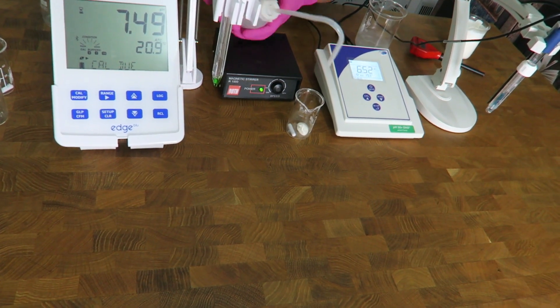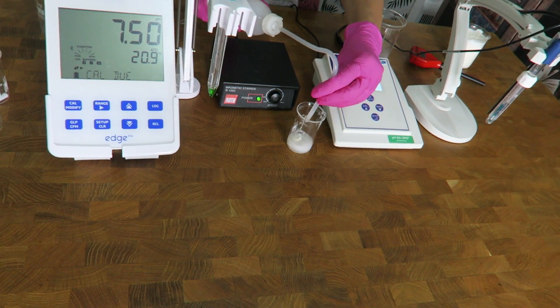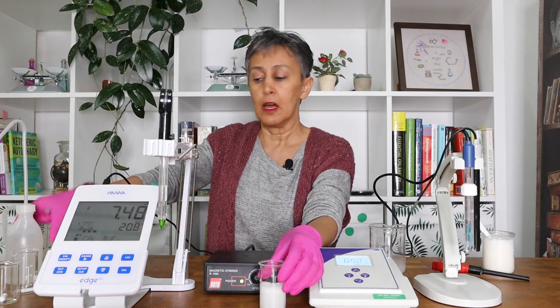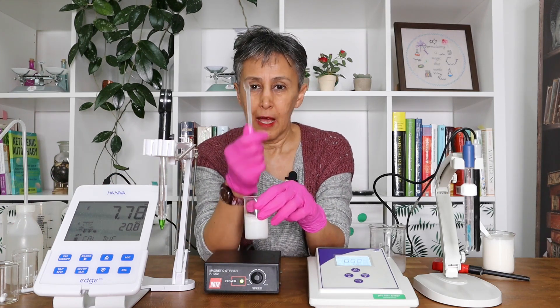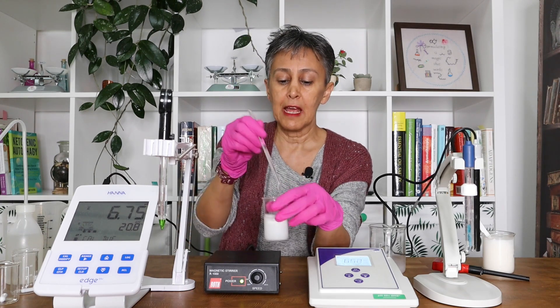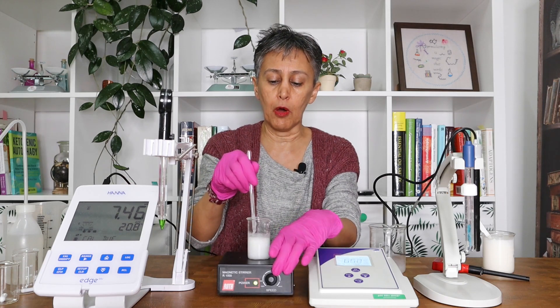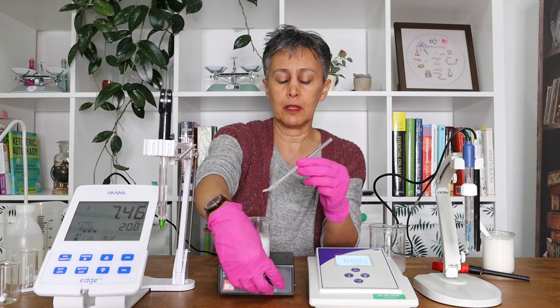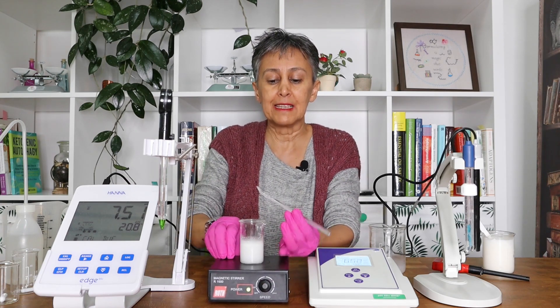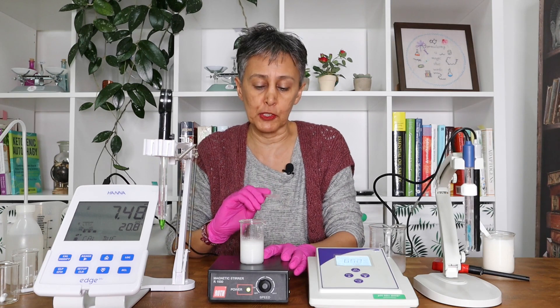Add your sample and dilute with water. Then, either old-fashioned, use a rod — a plastic rod or a glass rod — and blend your sample, or if you want the easier option, use a magnetic stirrer and let the sample stir to become completely homogenized.